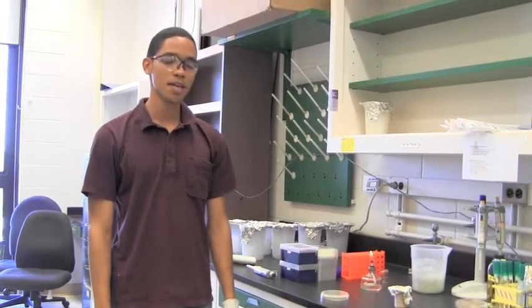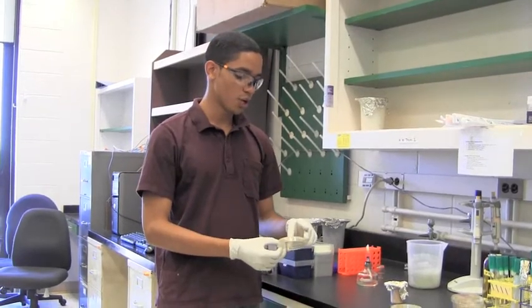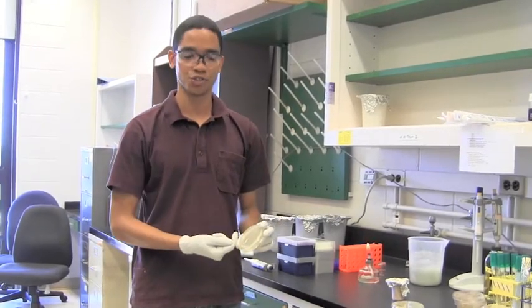Hello, my name is Simon and I'll be demonstrating how to make a spread patch plate. A spread patch plate is a method that we use to test a specific isolate for activity against a spread of our tester strain.